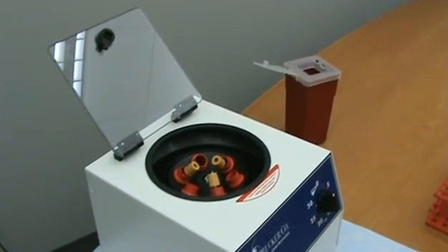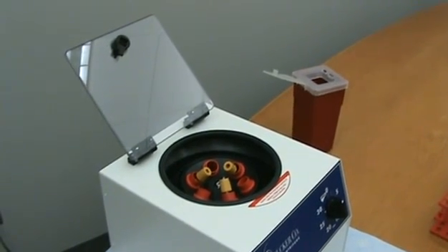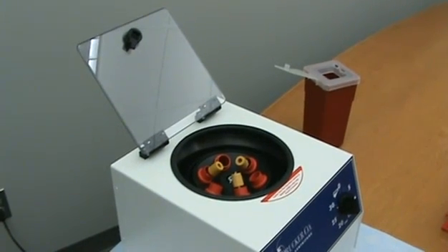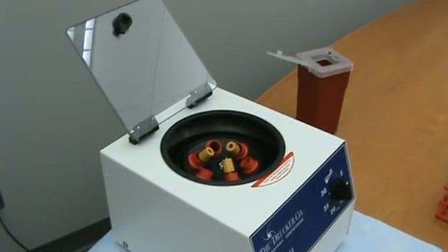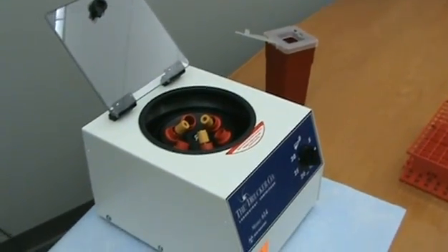An even number of specimens can be balanced by placing half of the specimens on one side of the rotor and aligning the other half directly across from these tubes. An odd number of specimens will require either the use of an additional balanced tube, or if you have three tubes, you may use this configuration and refer to flip cards for diagrams on balancing odd numbers of tubes.